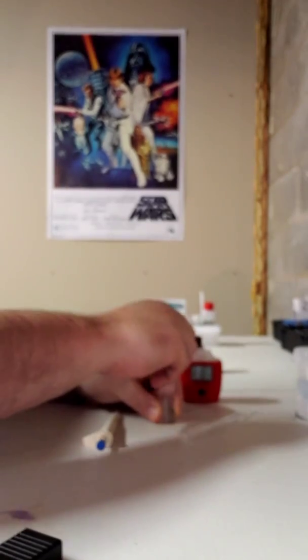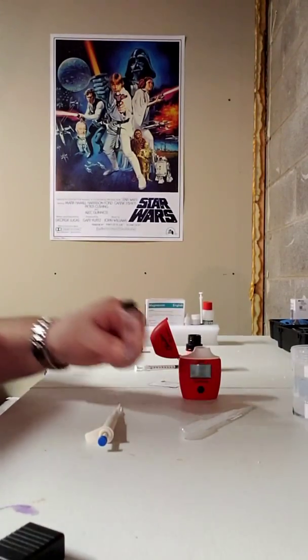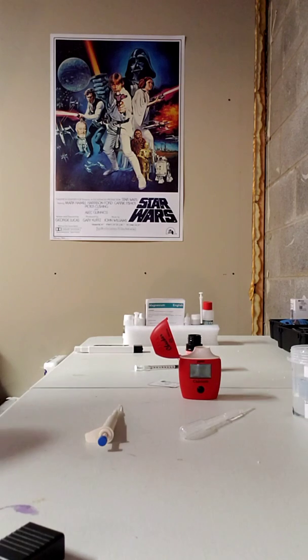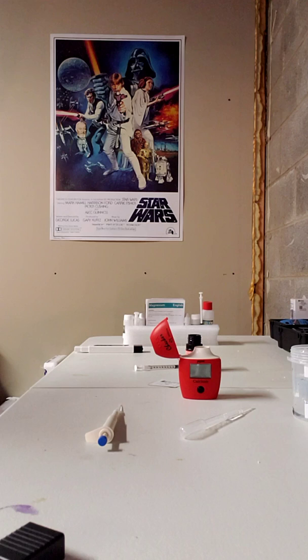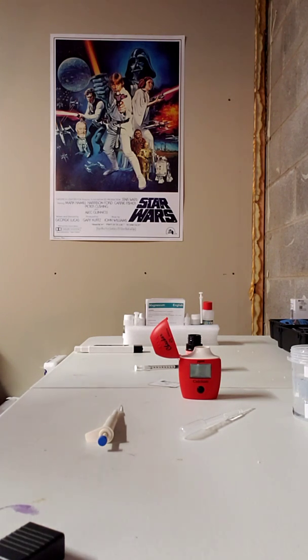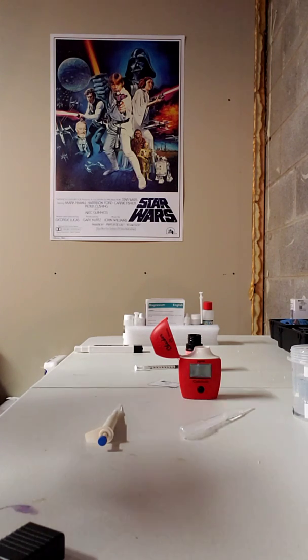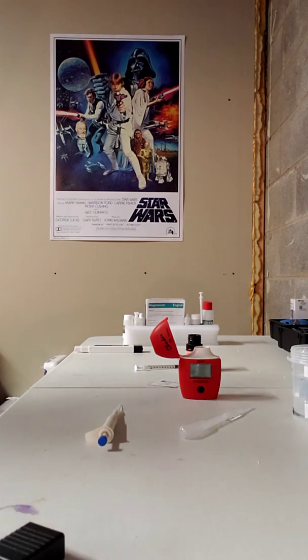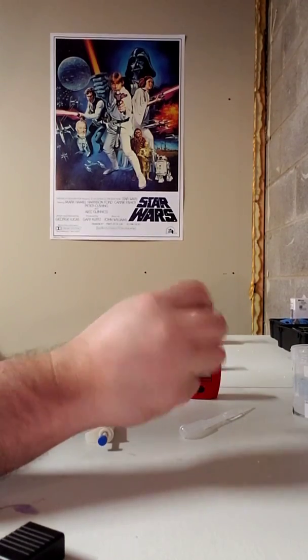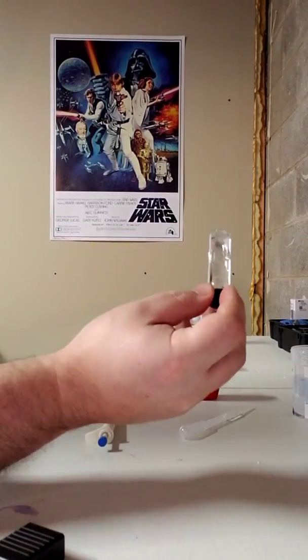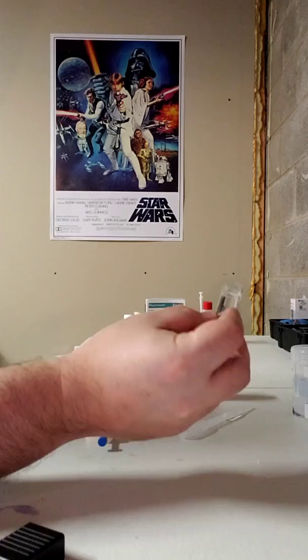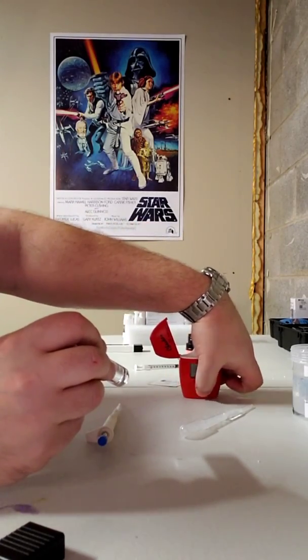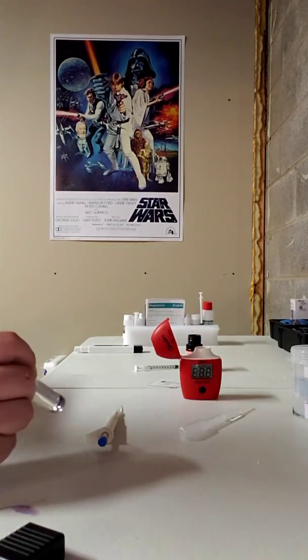Now I'm going to put the cap on this. I'm going to give this a quick clean because you definitely want this to be clean. Your collection tube needs to be clean so that the reader can actually read through. I'm going to give this a few inversions just to shake it up, mix all the reagent, turn on my handy dandy checker.